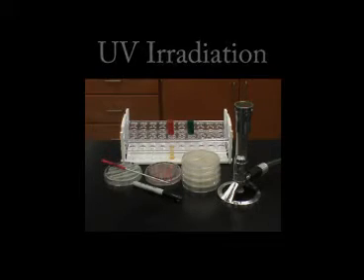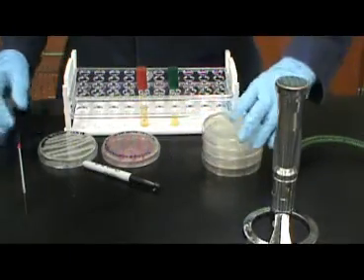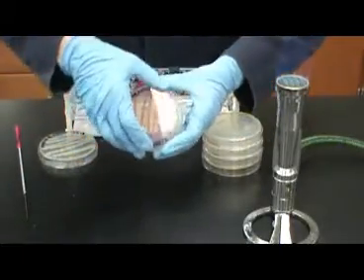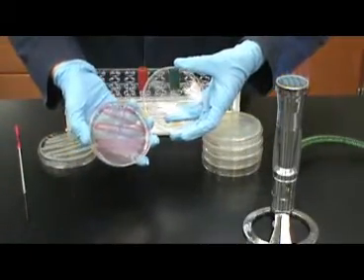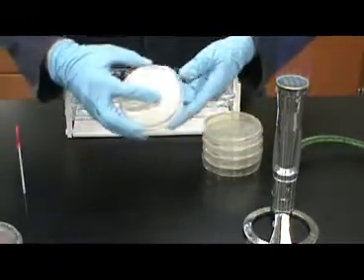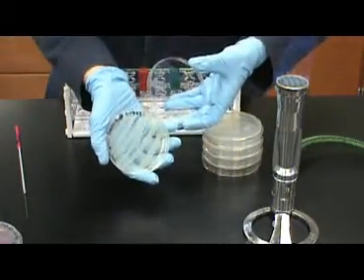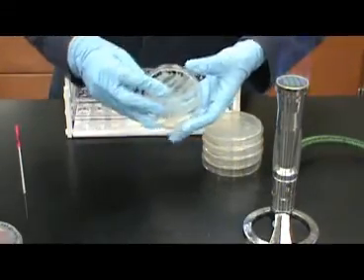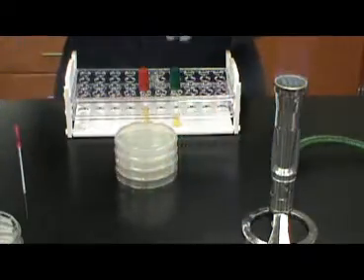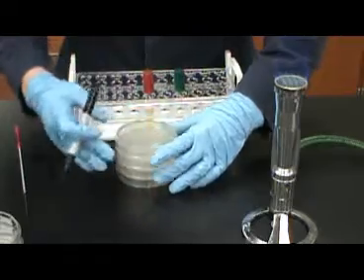UV irradiation, a physical method of control. For the UV irradiation exercise, we will be using a red pigmented Serratia marcescens. We will also be using a Bacillus, either Bacillus megaterium, cereus, or subtilis. Bacillus is used due to its ability to form endospores. Serratia does not form endospores. You will be comparing the difference between an endospore-forming bacteria and a non-endospore-forming bacteria.